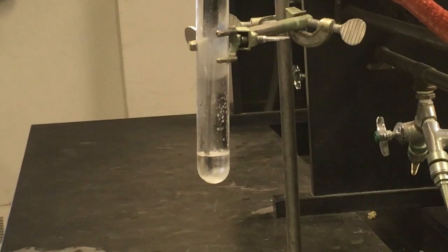Looking at our plot, which I'll show in a moment, we're starting to see a little bit of a plateau. So we're starting to get what looks like our first crystals. It looks like the first crystals formed at about 69.4 degrees Celsius, from the thermometer I'm looking at. Remember, 69.4 is not necessarily the freezing point. You're going to look at the data plot that I give everybody to make that determination. But that's where we first started to see some of this crystallization happen.